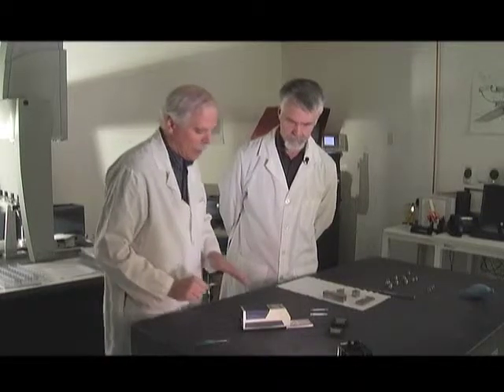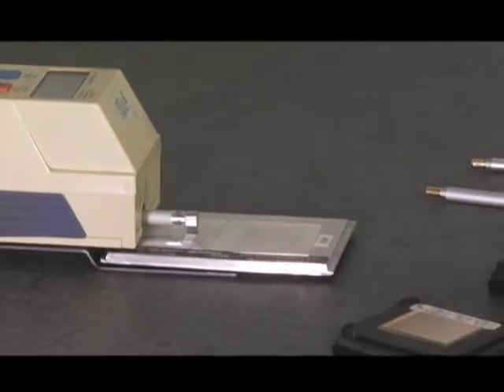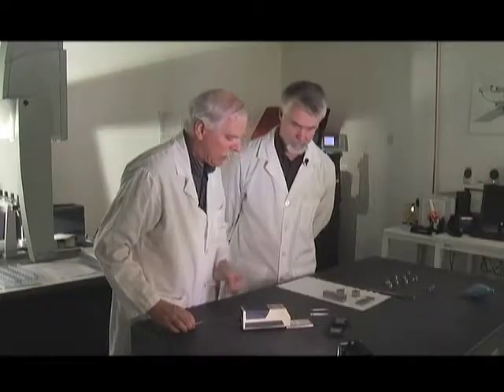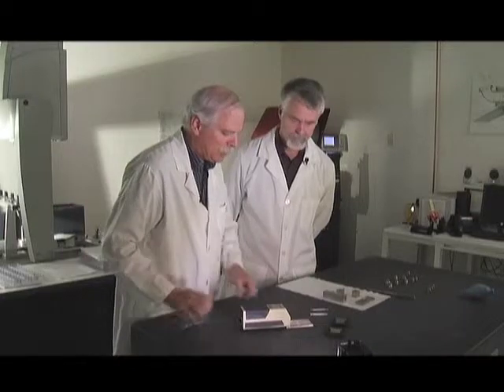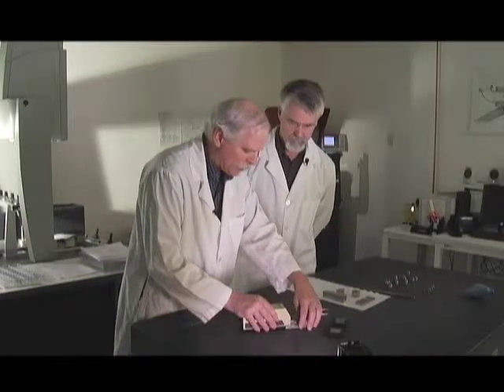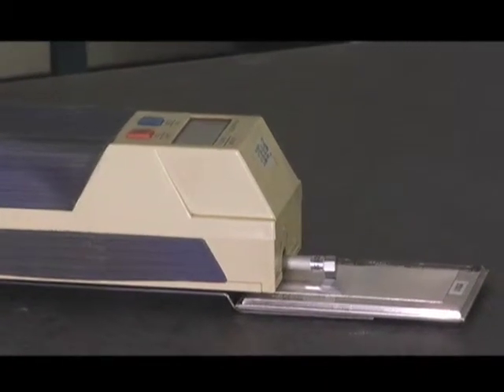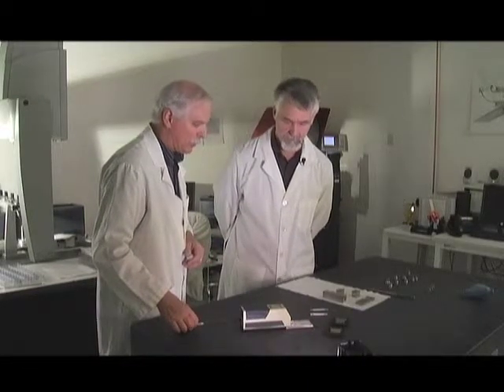In a calibration lab, the stylus will typically wear over time. Other than physically damaging the unit, the stylus is the only part that really wears out. As it rubs repeatedly, it eventually loses some of its shape. We check the stylus with the finer patch — this one happens to be 15 micro-inch. As the stylus wears, it typically reads a lower number because it's flattening out. There's a limit to how much wear is allowed before the stylus needs to be replaced.